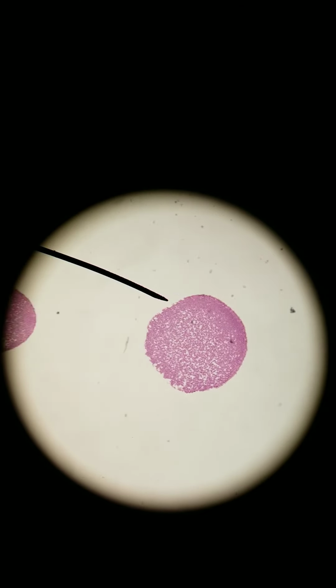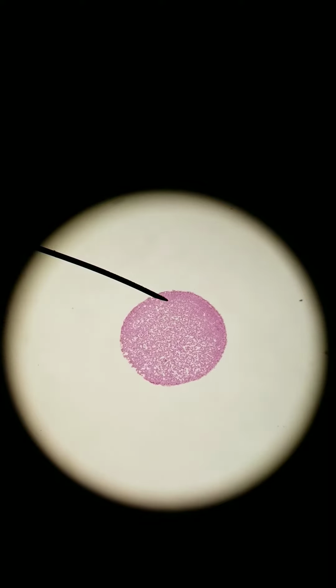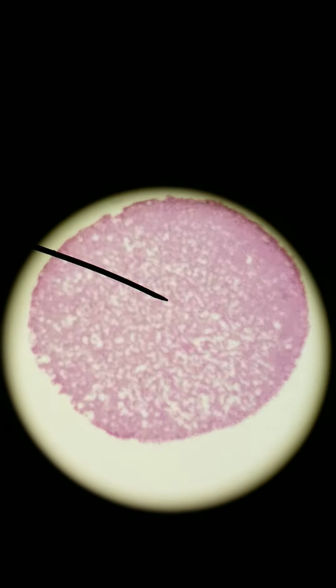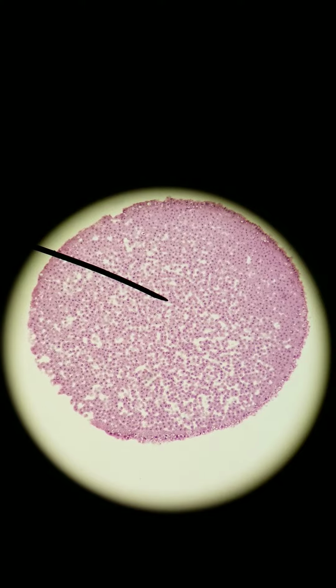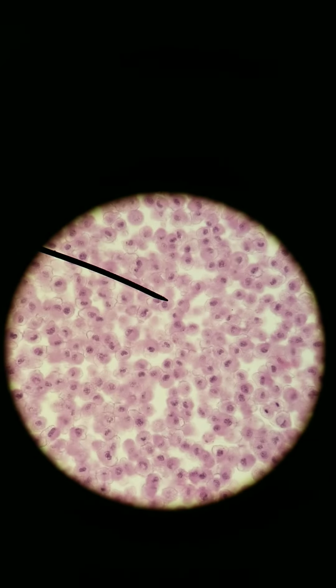And I'm probably going to skip around because it's not always guaranteed that you're going to find a cell in a certain phase. So we'll start here. It doesn't matter. All right, moving in closer, we're at scanning. Going to go to low power, 100x total. Still not close enough to see the phases of mitosis, but we can see individual cells. Here is our high power, 400x total.